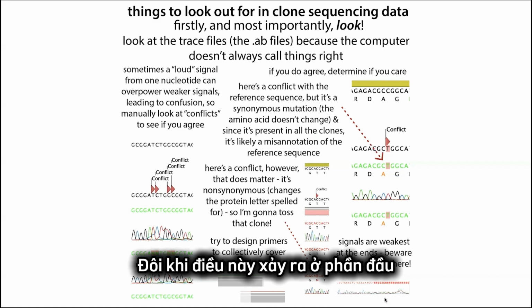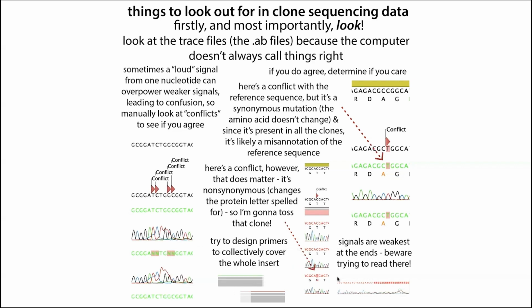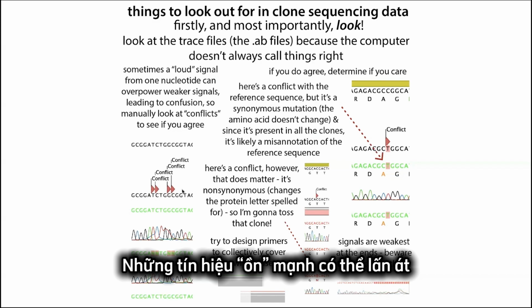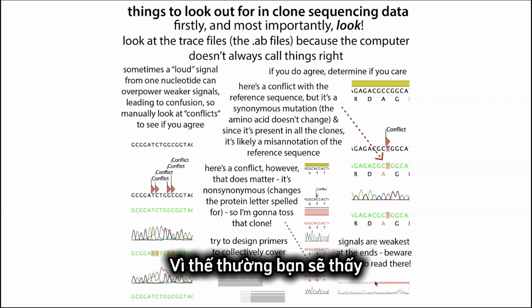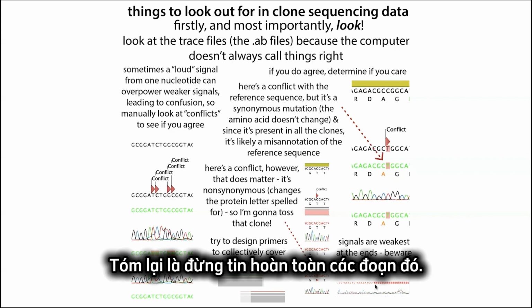Well, sometimes this happens at the beginning and the end of the reads, in addition to things like peaks being close together or contaminating things where the louder signal is going to outcompete. In the beginnings and the ends, basically the first 50 and last 50 or so nucleotides that are read out, you can't really trust them. Often they'll have Ns, but sometimes they'll actually try to guess some of them, so basically don't trust this.